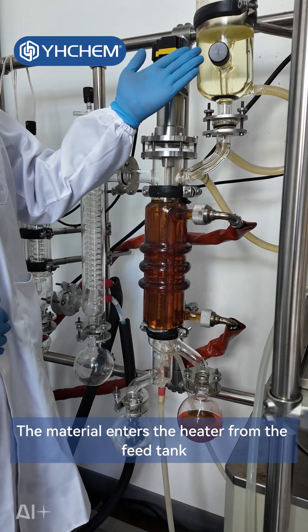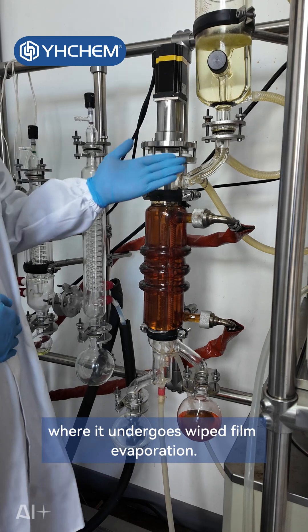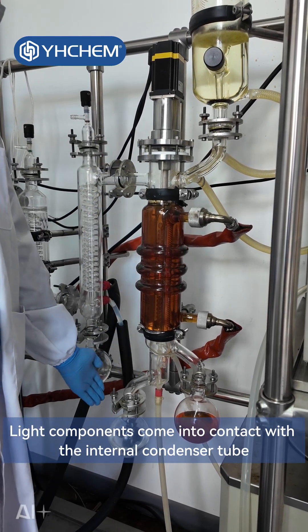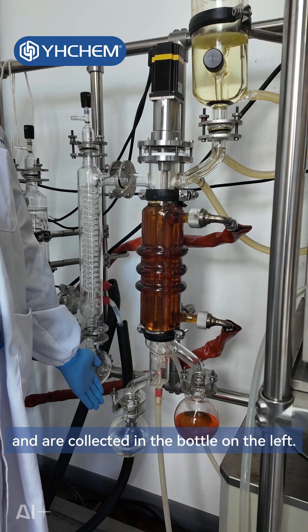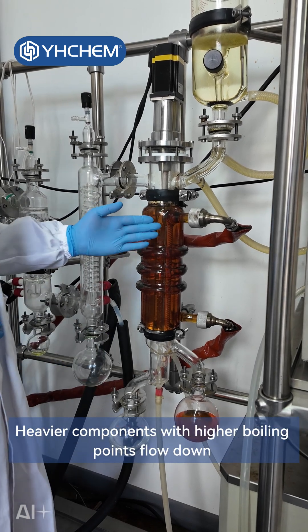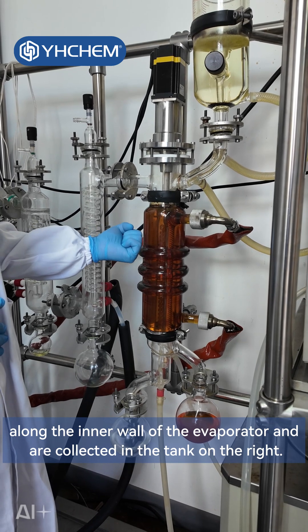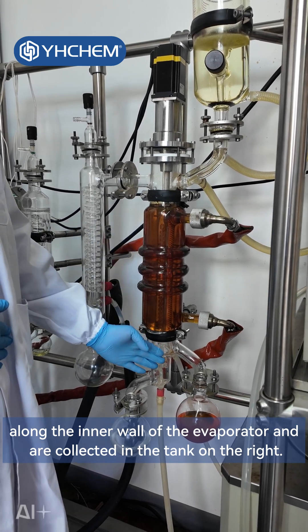The material enters the heater from the feed tank, where it undergoes wiped film evaporation. Light components come into contact with the internal condenser tube and are collected in the bottle on the left. Heavier components with higher boiling points flow down along the inner wall of the evaporator and are collected in the tank on the right.